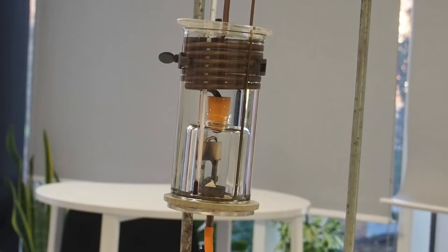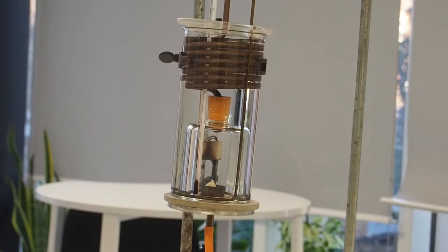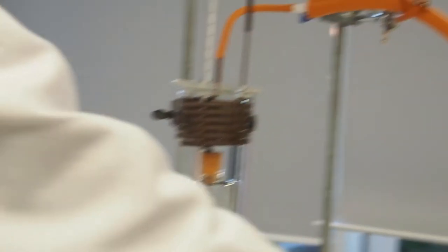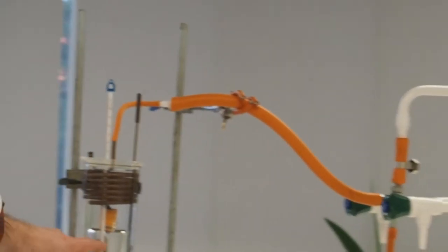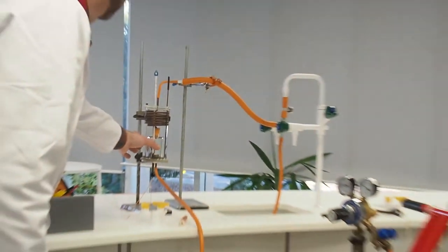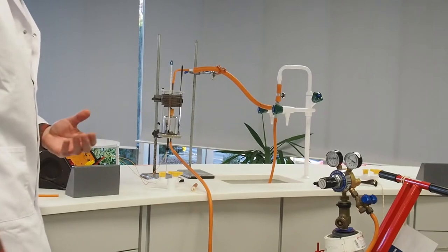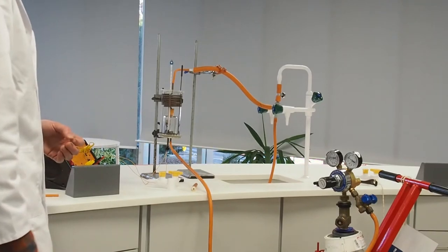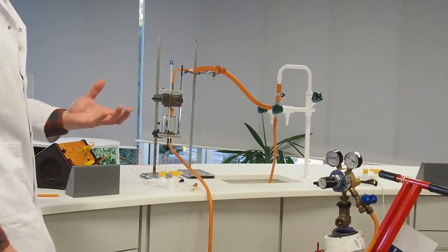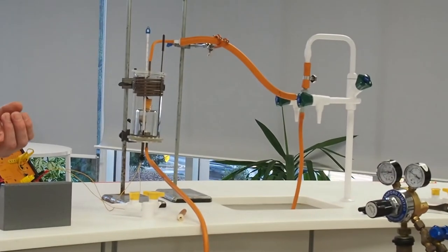Another factor that we're going to be controlling for in this investigation is to burn the food in 100% oxygen. That's why we have our oxygen cylinder here which is filling up this glass in the middle here with 100% oxygen. So when we burn it we get complete combustion of the food type. You'll remember last time the test tube ended up very black because of the incomplete combustion that we saw occurring.